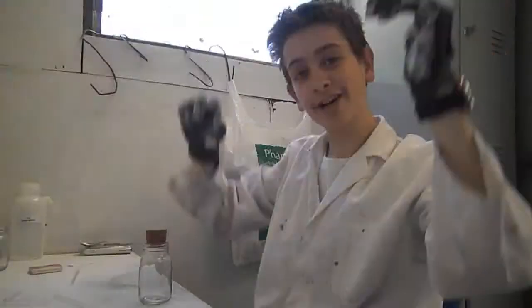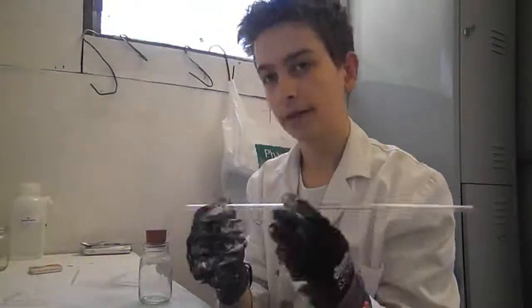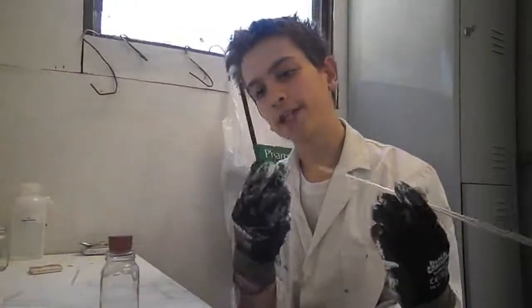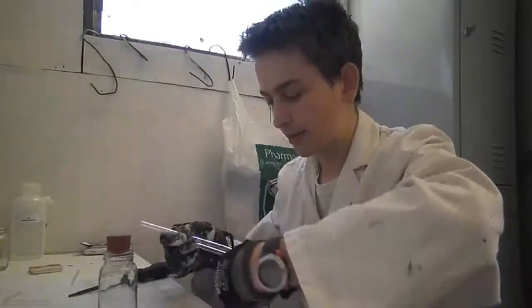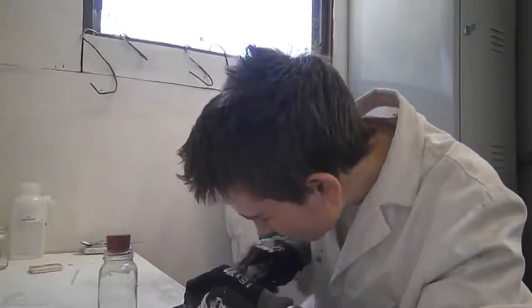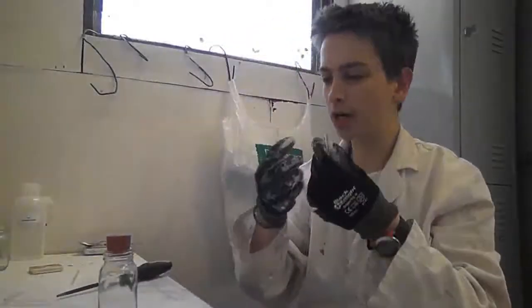Alrighty, so now I'm going to just cut my glass rod to size and I'll bend the piece that needs bending. So what I've got here is just like a triangular file. Voila, snap it off. I'll just make another piece. Alrighty, and there we go.